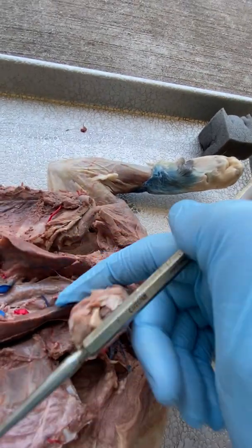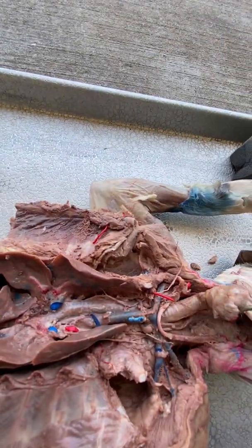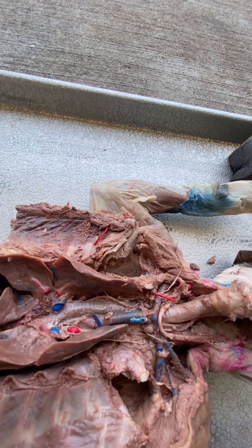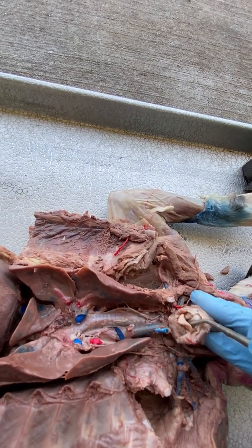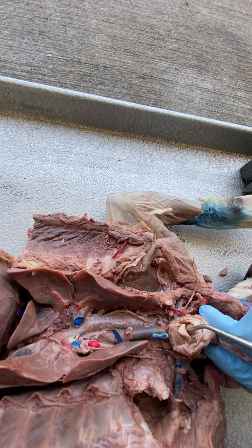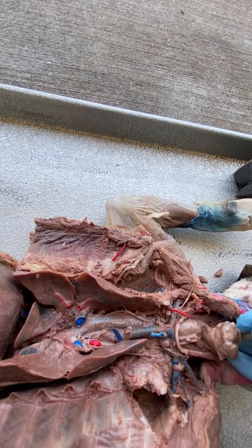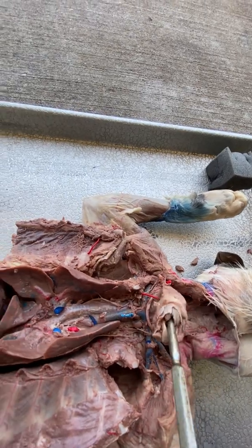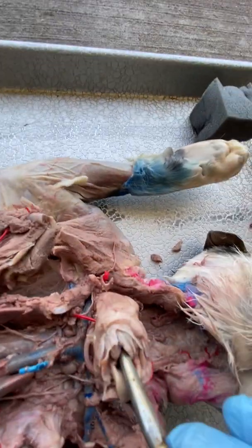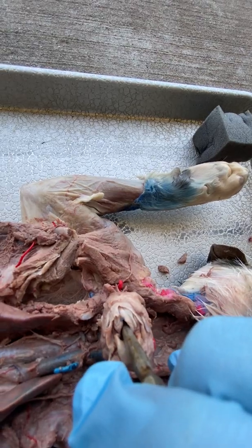If I spread this open a little bit more, we have a hole. I can put my probe down into our trachea — that's where our air is going to go. The skin that's right on the outside is going to be our true vocal cords.